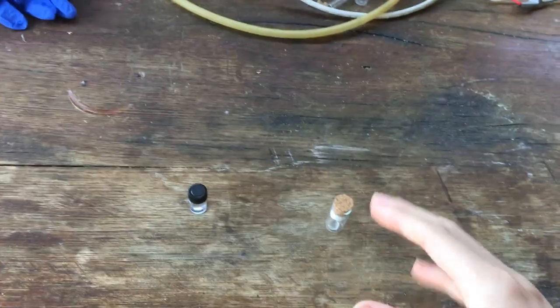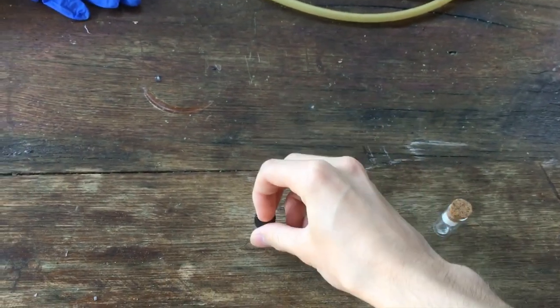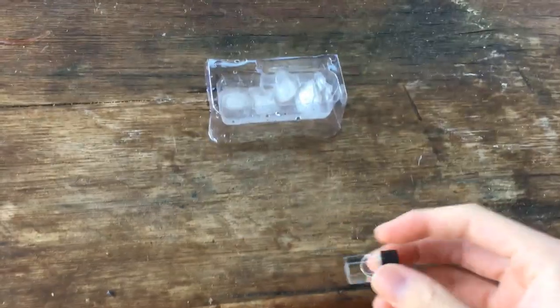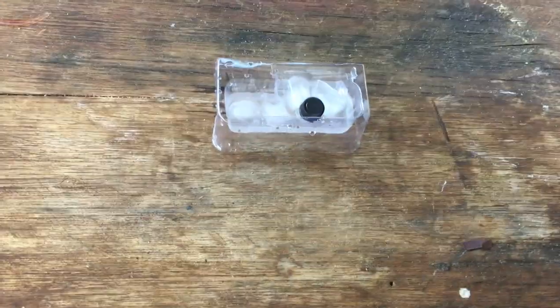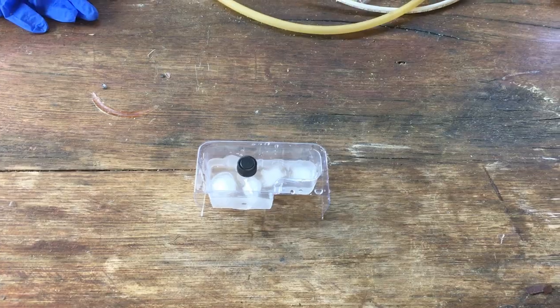We can now do all of those experiments with some real heavy water just to show you what that looks like. First of these experiments is making the water freeze at 0 degrees like we were trying to do before. So let's just repeat that, but with the real heavy water, stick that in some ice water and see if it freezes over the next 15 minutes or so.